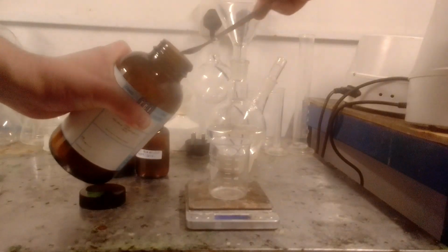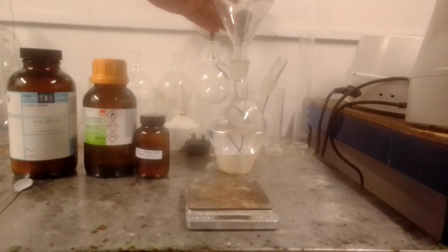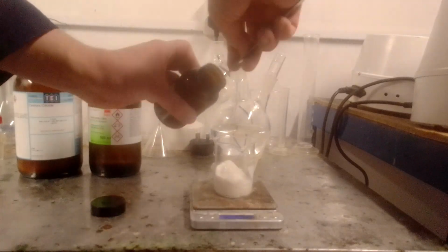Once the acetone had been dried, benzoic acid and cyanuric chloride were dissolved in it. Both dissolved within a matter of seconds. As an aside, the cyanuric chloride powder generated a lot of very fine and extremely unpleasant dust when handled. After the first attempt, I made sure to use a dust mask.